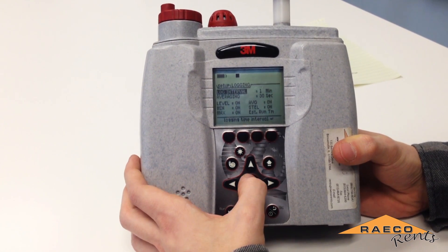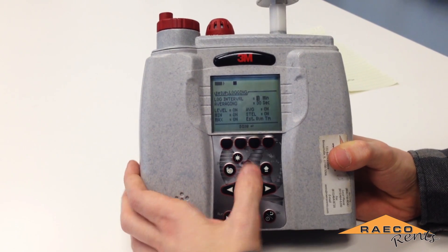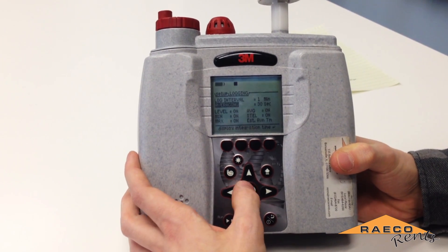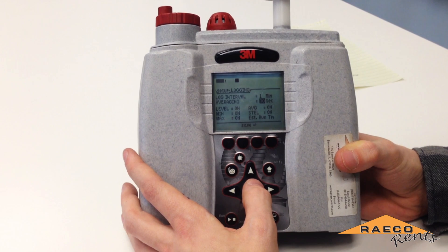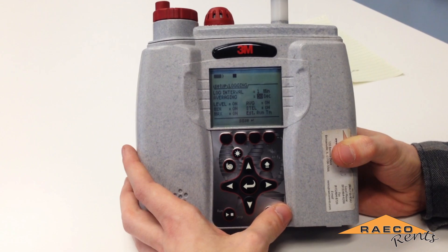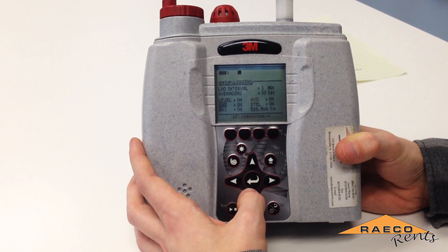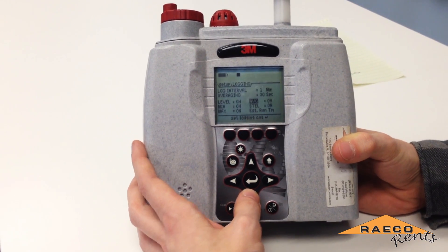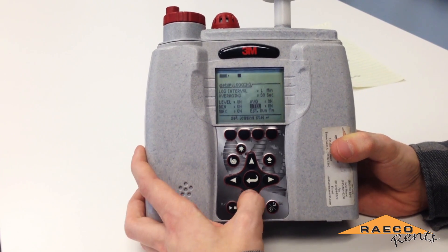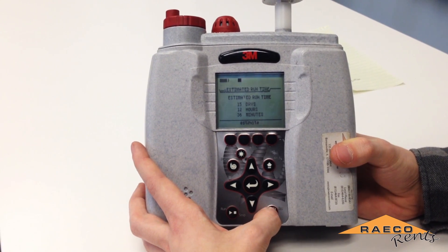We want to make sure to set up the logging interval. Press the enter button with logging interval highlighted, and then use the arrow buttons to adjust your logging interval. The averaging — which is how often data is refreshed on the display — should be equal to or less than your logging interval to make sure it's always logging something different. You'll also want to make sure that level, minimum, maximum, average, and short-term exposure are turned on if you choose to log those. You can also see how much runtime you can get from your total data log.